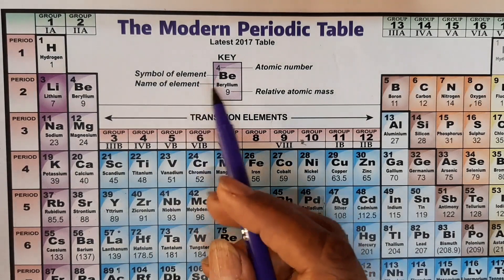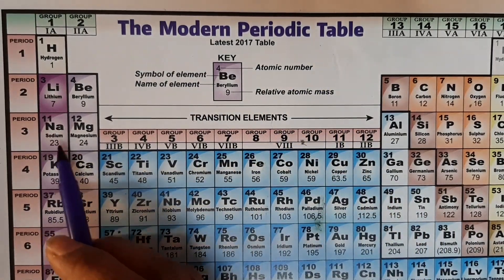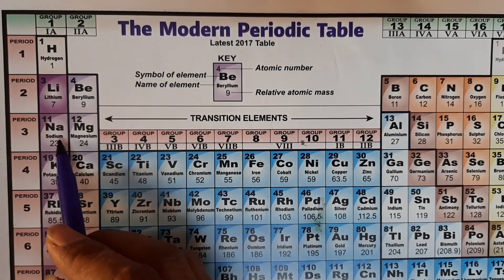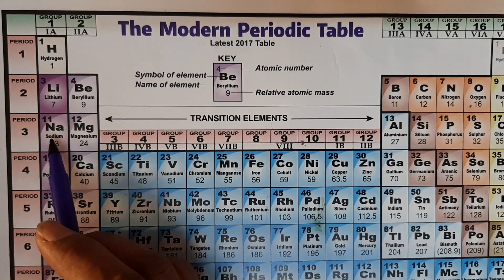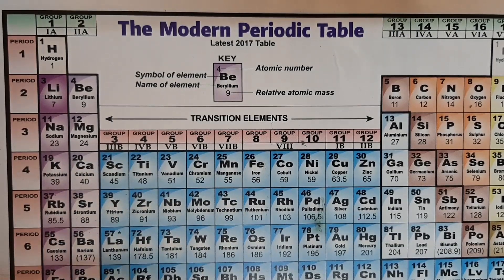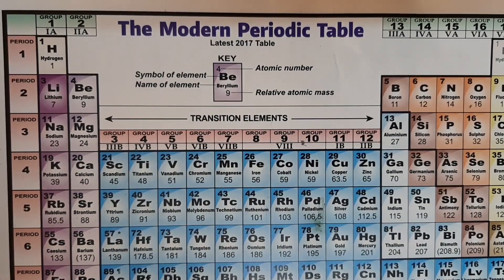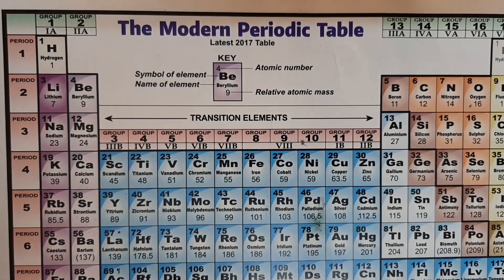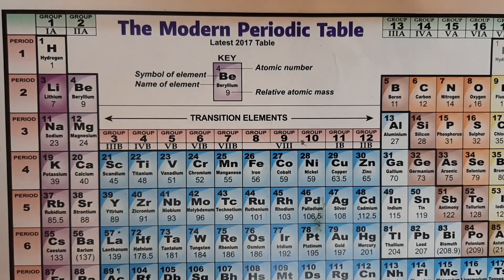Looking at the modern periodic table, sodium is in period 3 and group 1. Being in this position it is highly reactive. Why is it reactive? Because it even reacts with oxygen in the air and forms an oxide, so it cannot be perceived as a shiny metal.